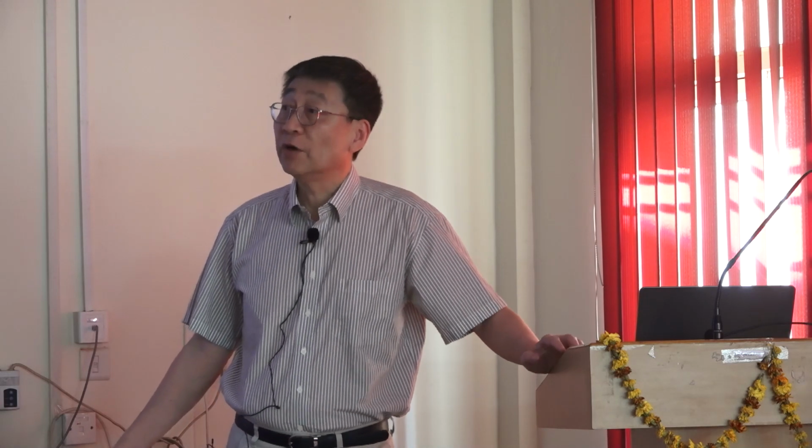Good afternoon. Thank you. So what should we do? Should we do the Coot and PyMOL things first, and then look at what I talked about this morning? Is that what you have in mind? PyMOL and Coot, right? You can do that. They will do PyMOL and Coot first? Yeah, first. Okay with me. Okay, then let's do Coot first.